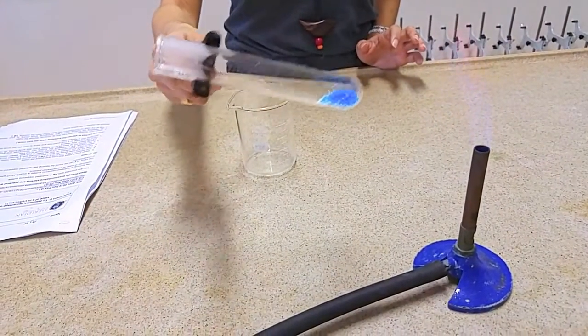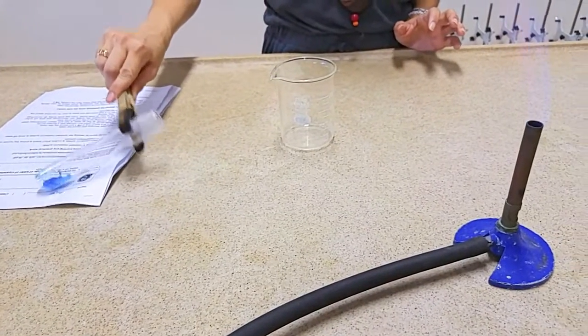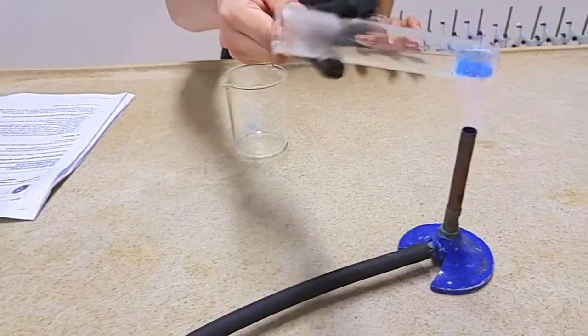So at this point, you can give it a light tap on the table to break up the solid, then carry on heating.